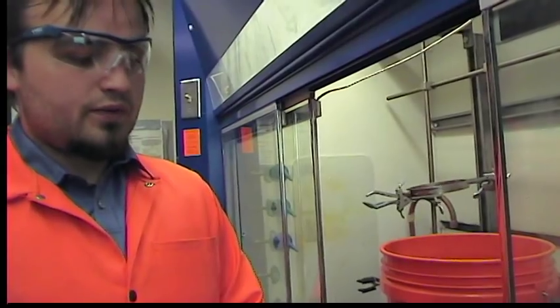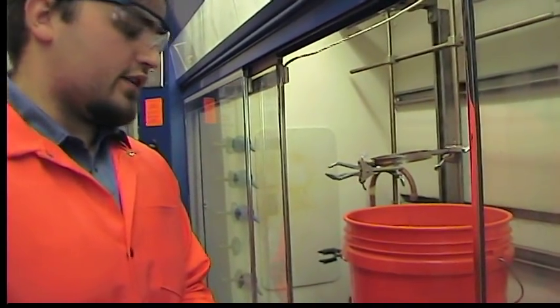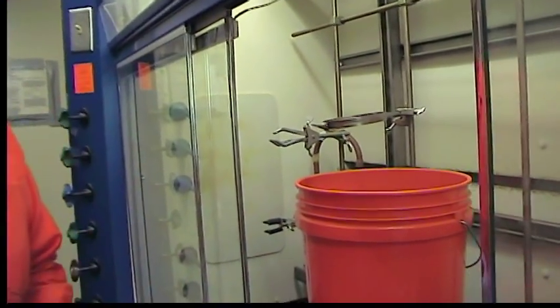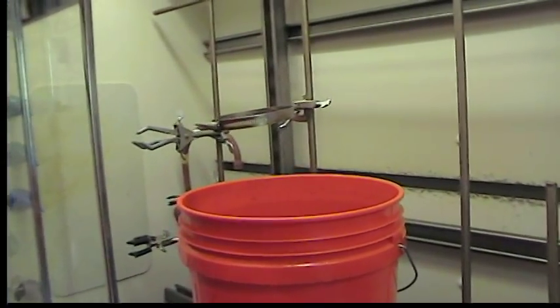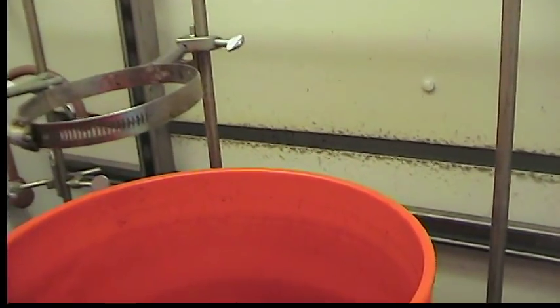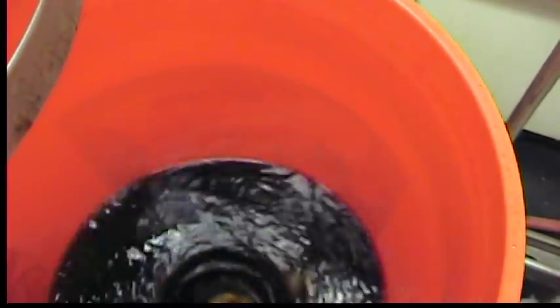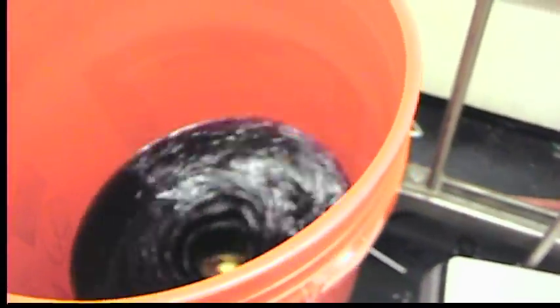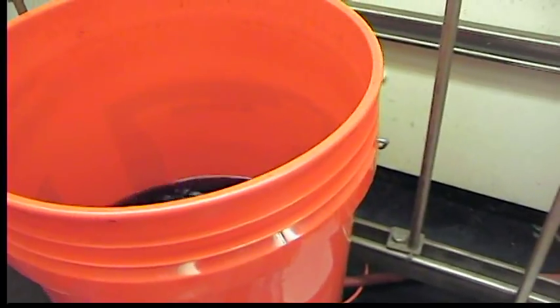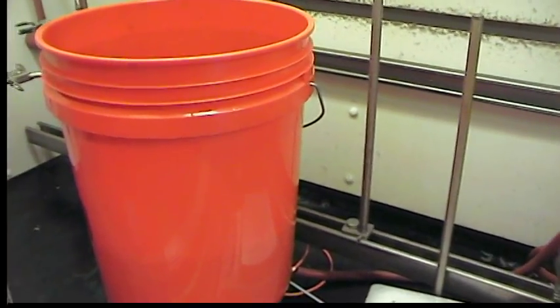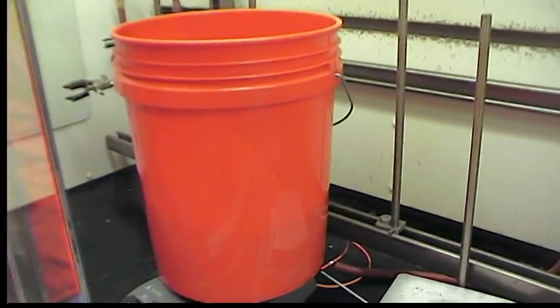We've finished adding the pyrylium salt. We've finished with the synthesis of the aniline ligand. The pyrylium salt was added slowly and then we left it stir overnight. During this time the mixture darkened and has a red color. Now we're going to slowly remove the solvent and concentrate these almost eight liters of liquid to about a liter and then extract the desired product.